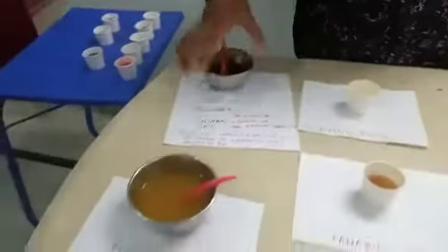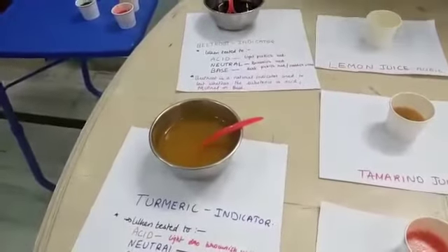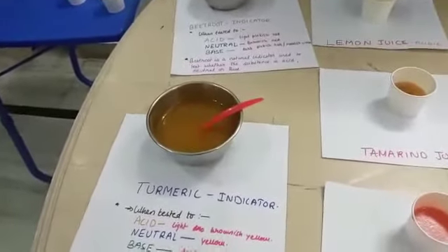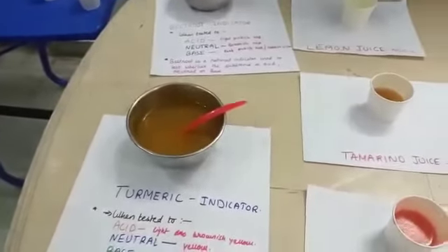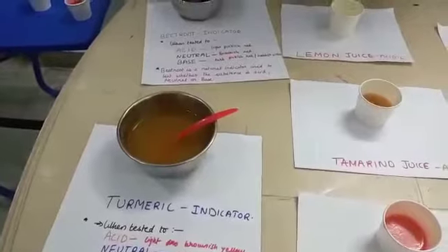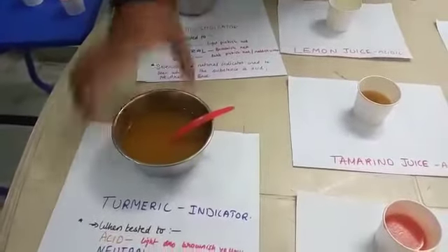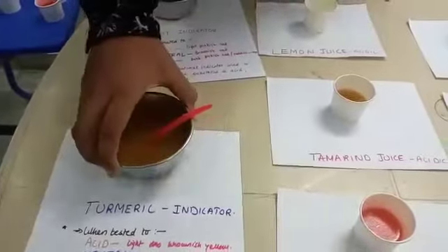Now let us use turmeric. This is also a natural indicator. When it is added to acid, it appears in light brownish yellow. When it is added to neutral, it appears in yellow color. And when it is added to base, it appears in dark brownish yellow.